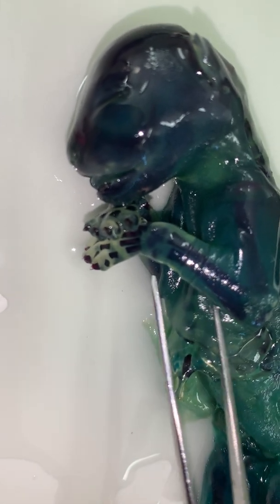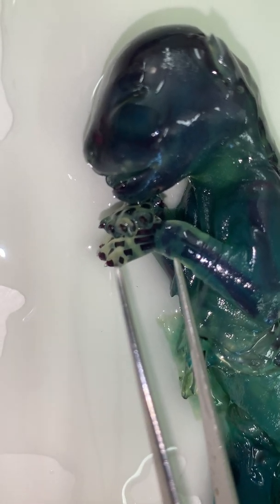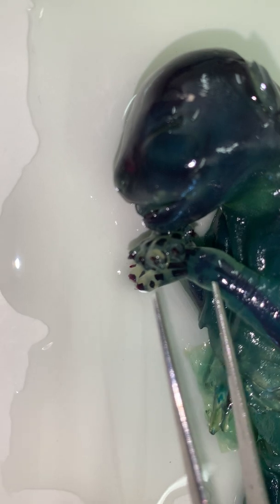So what we can see here on the wrist, we have our arm bones, lower arm bones here, the radius and ulna. And then we see a space there. Normally that would have been cartilage in a specimen of this age. But since the cartilage didn't pick it up, we just see it as clear. And then we see the ends of the bones. So the epiphyses, which are the ends, aren't fused yet to the diaphysis or shaft. They're separated by this cartilaginous area, which is called the epiphyseal plate.